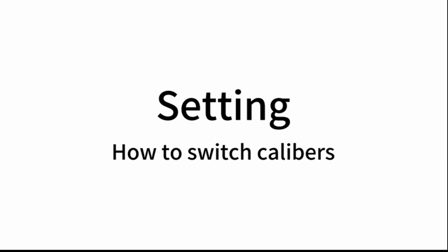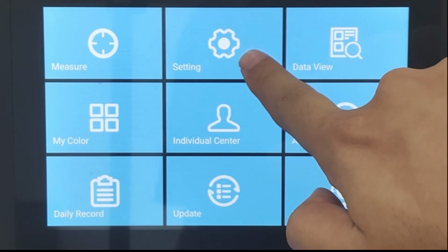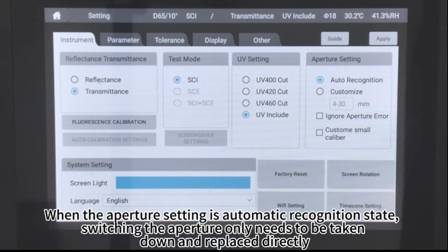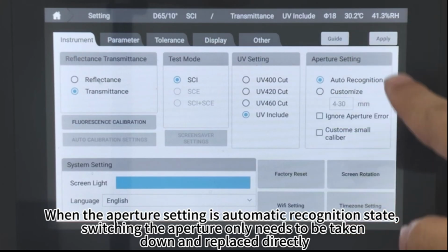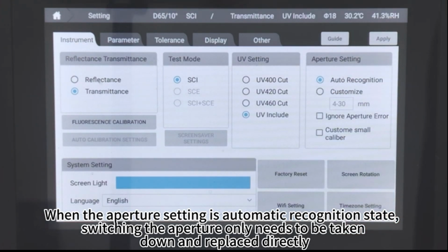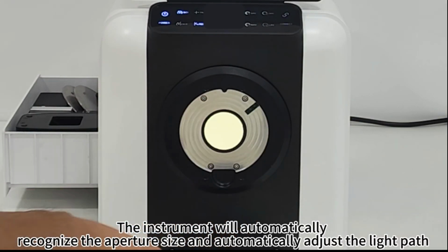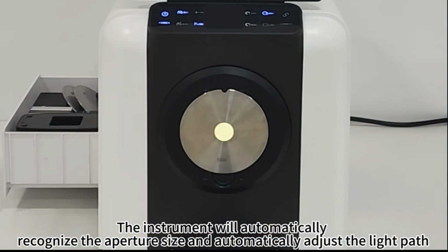Setting. How to switch calibers. Click Setting. When the aperture setting is in automatic recognition state, switching the aperture only requires taking it down and replacing it directly. The instrument will automatically recognize the aperture size and automatically adjust the light path.